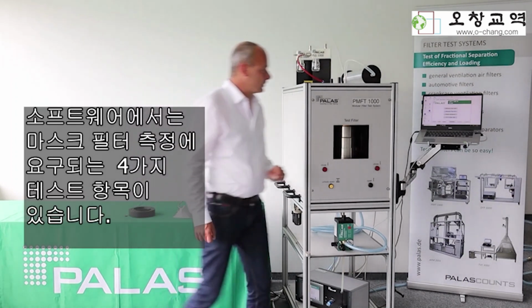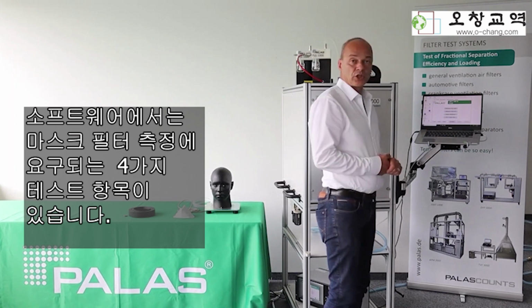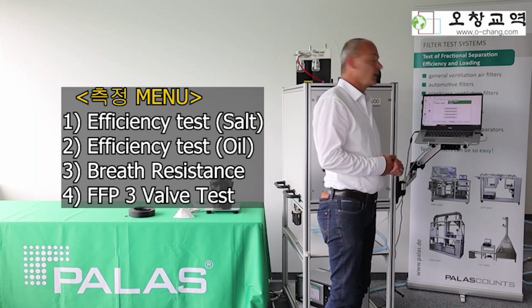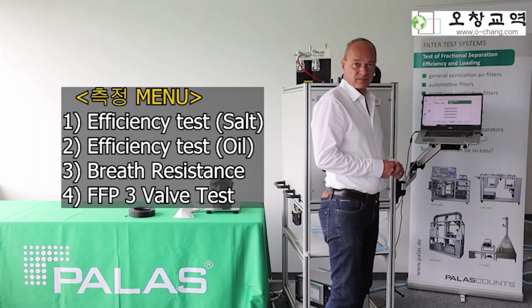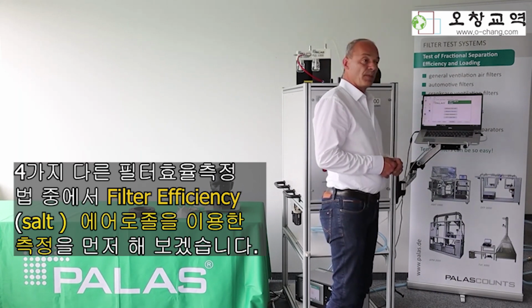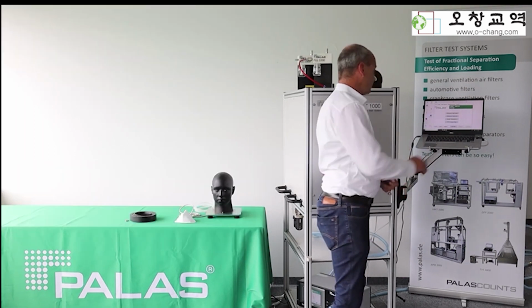After start of the software, you see here 4 different tests which are available: the efficiency test for salt, the efficiency test for oil, the breath resistance, and the FFP3 valve test. We start first for a full test with the different screens, with the efficiency test for salt.